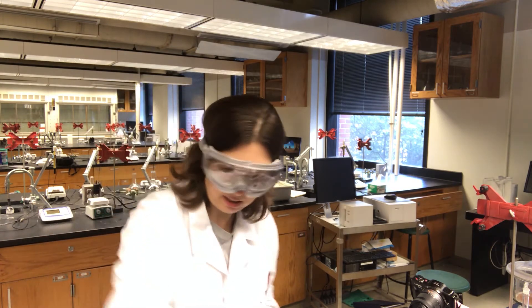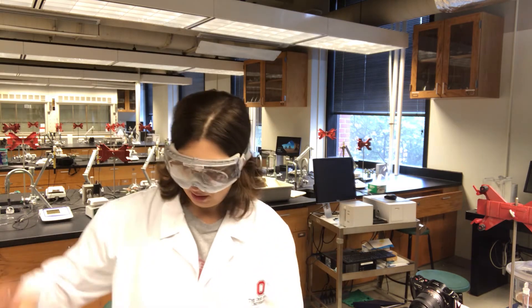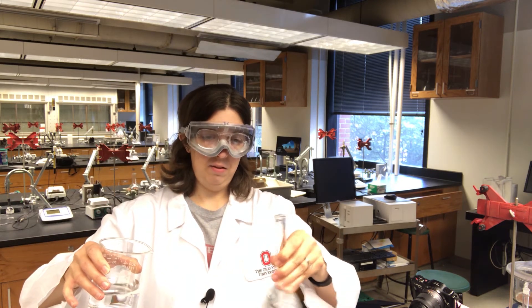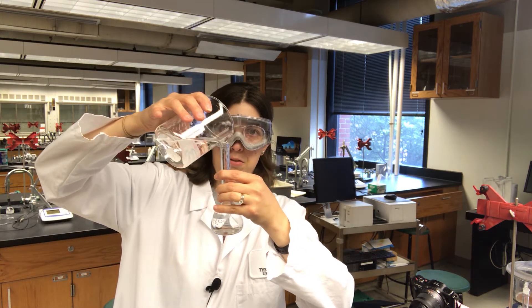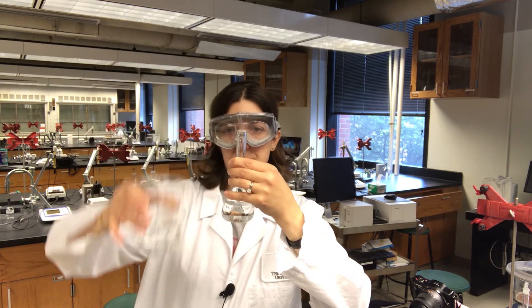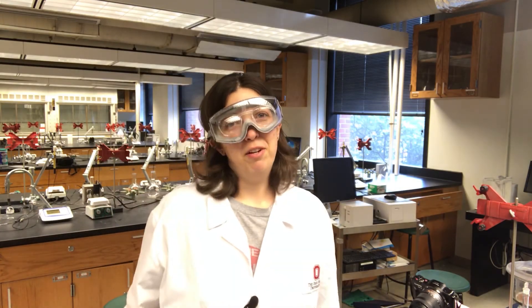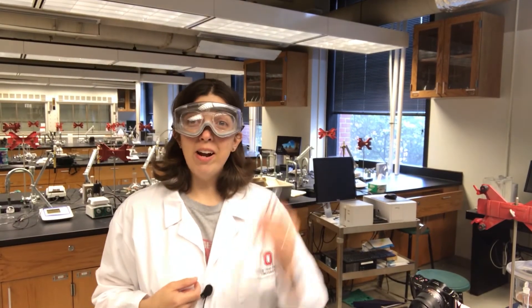My ISA has been added, and I'm going to dilute with water. Mix just a little bit and fill to the line. Oh, I went over — start over. That's never fun, but you have to start over.